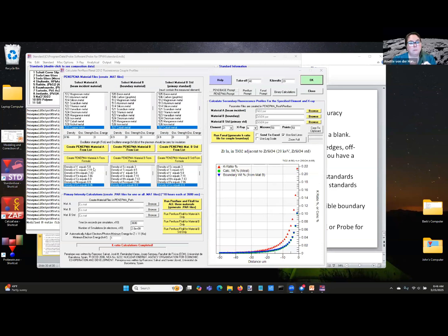Yes. And so we use that for nickel sulfide, nickel olivine kind of corrections, where again one element is a major element in the one phase and another in the other, and so you can also put in your actual mineral compositions as a material file. Yes, those are based on standards or other materials. So you might have a material file for forsterite and fayalite, but what you're trying to look at is maybe Fo75 or something. So you can produce that.